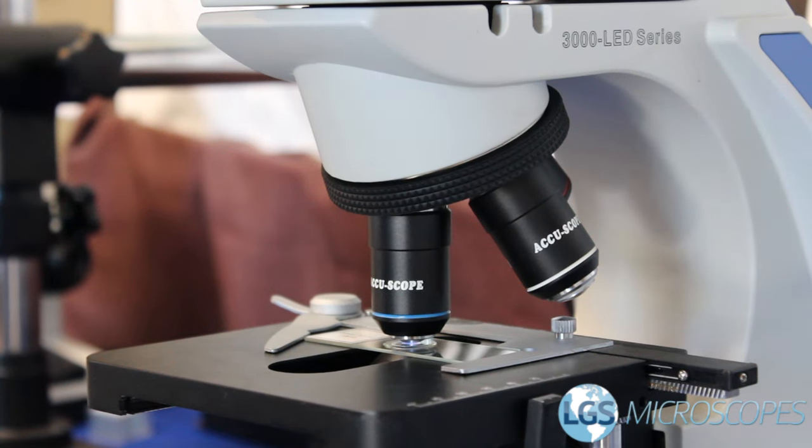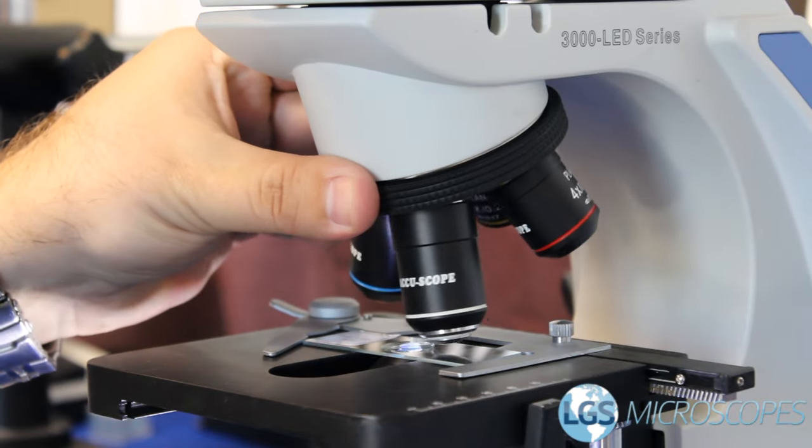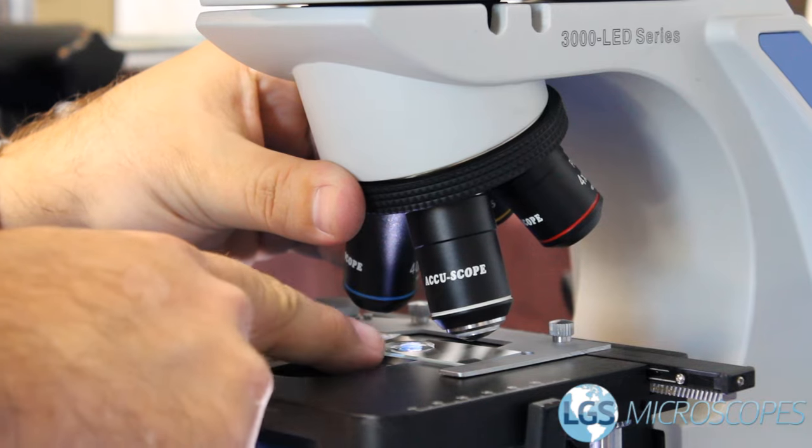This is normally caused when someone uses the 100x oil objective and then swings backwards to the 40x objective. Then you end up dragging the 40x objective through the oil.